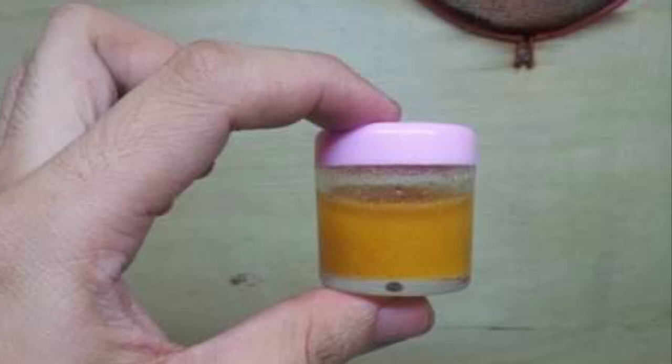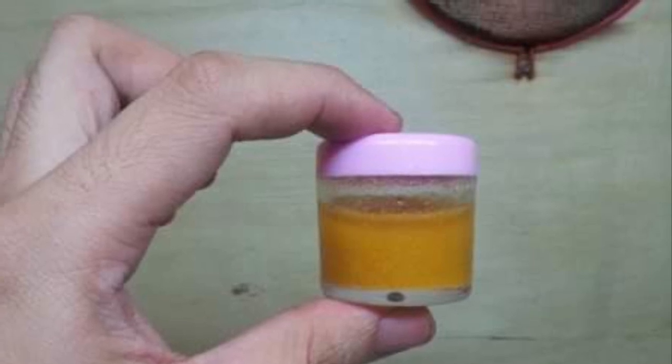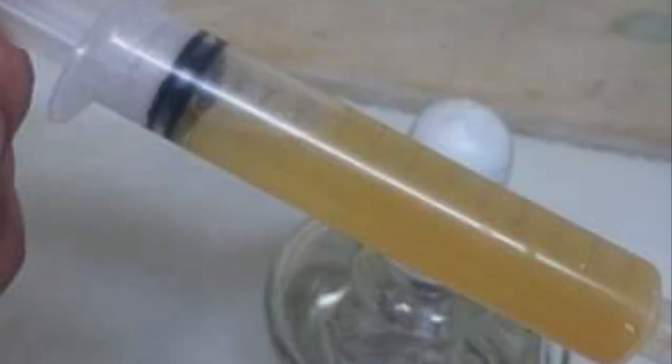As soon as the color shifts into a lighter shade or color tone, the bleach or hydrogen peroxide may be discarded. The bleach-sterilized seeds need to be washed with sterile water. Hydrogen peroxide-sterilized seeds may be planted directly onto the freshly prepared media.